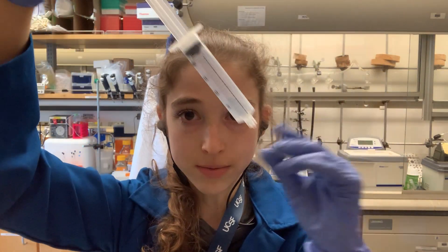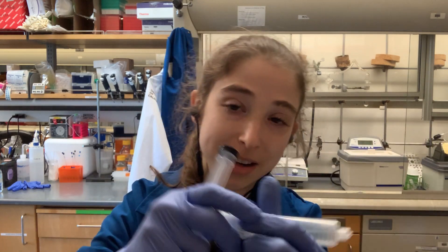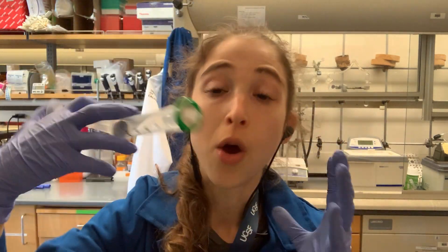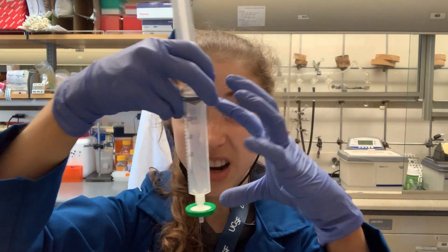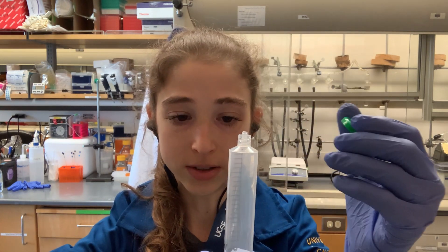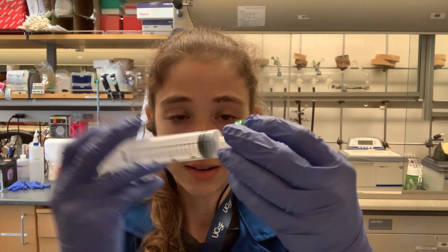To load a syringe filter, you can pull liquid up directly if the tube fits. For larger containers like a 15 mL Falcon tube, remove the plunger first, attach the filter, then pour in your solution. When you push down you'll find a lot of air pressure built up. To fix this, flip it over, remove the filter, push the plunger down until just a little air remains, then reattach and push through.